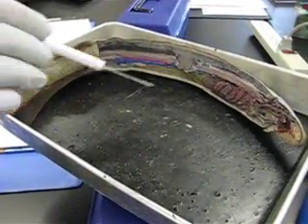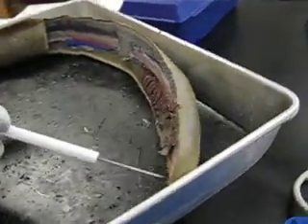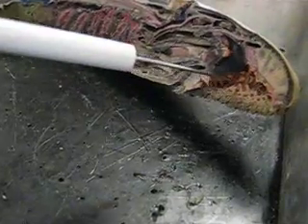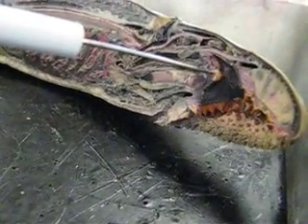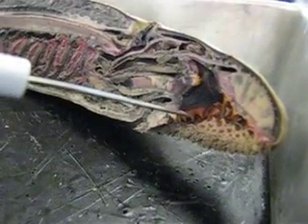This is the lamprey external anatomy. Here's the head. This is the buccal funnel. This is the papillae. These are the teeth. This is the tongue with the teeth. This is the mouth opening and the buccal cavity, which is the same as the buccal funnel.